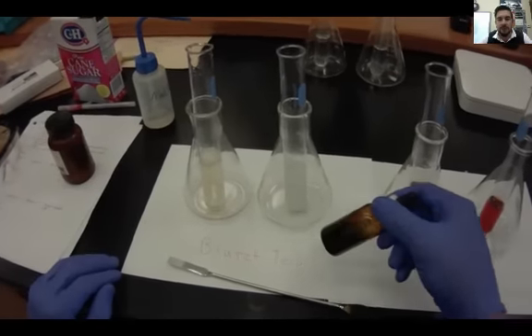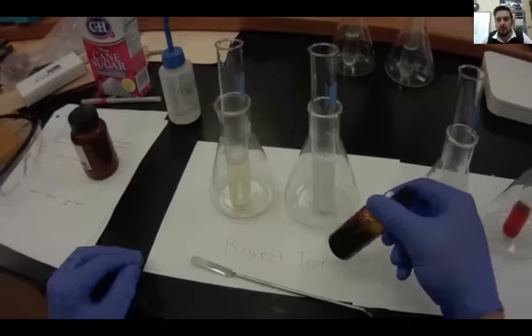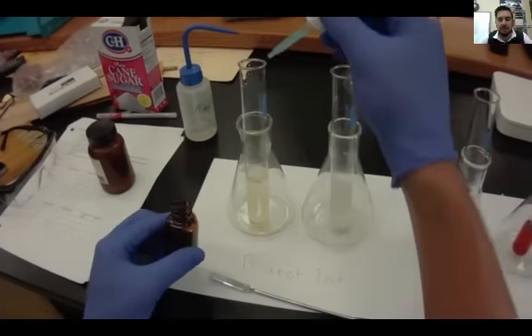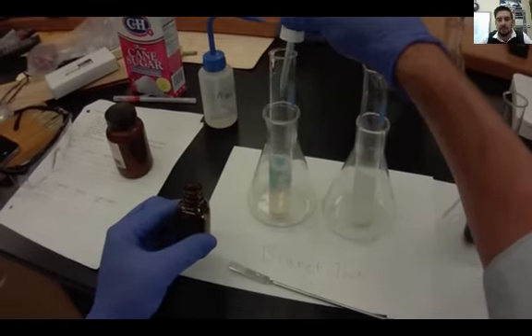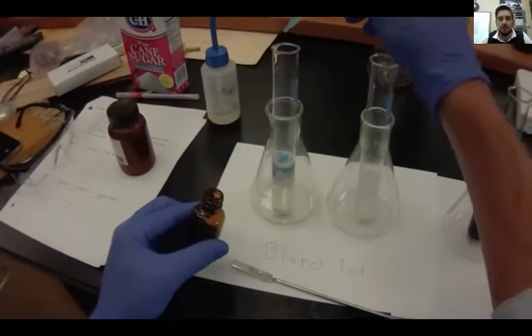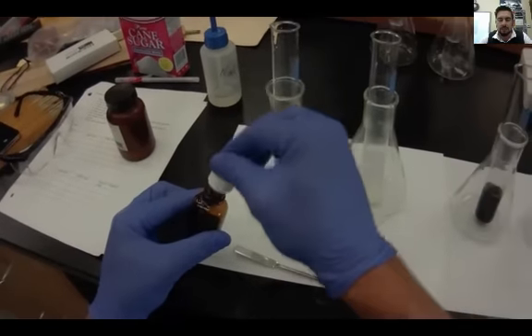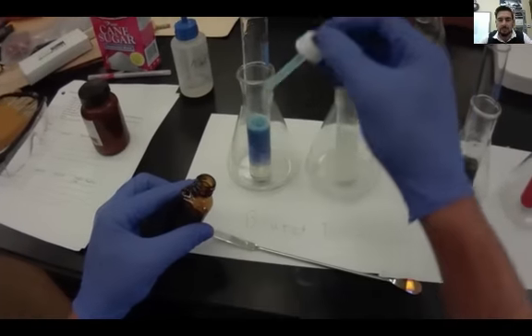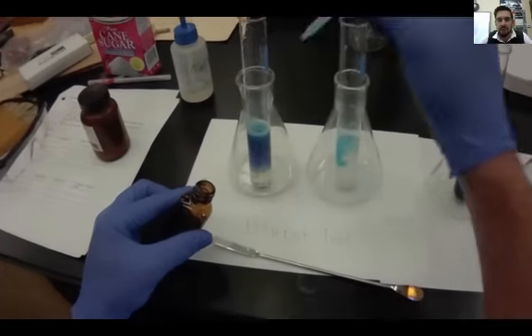And then we got to put in some copper sulfate, which I have in this tube with a little dropper here. What we should see happen is a violet-y color, more like a purple. I'm going to keep going, there I go, and into the other two. One of these has a protein and I want to find out which one.